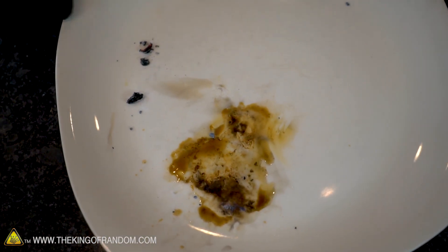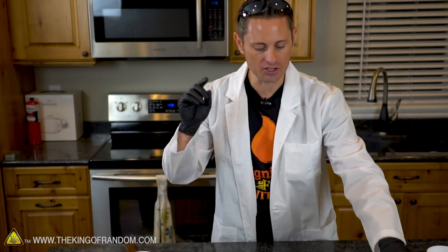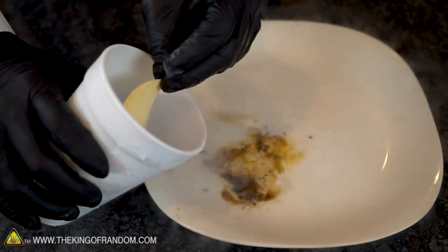These chips just randomly spark up - that's cool. All right let's try that again. Let's get one of these chips soaking, but the oxygen burns off a little too quickly. So what I'm going to do is pour a little bit of oxygen into the plate as well before we actually light it off.